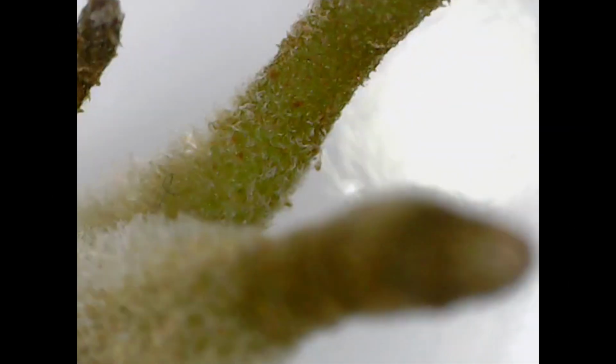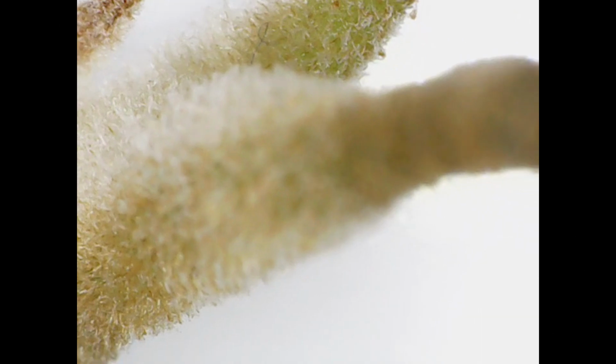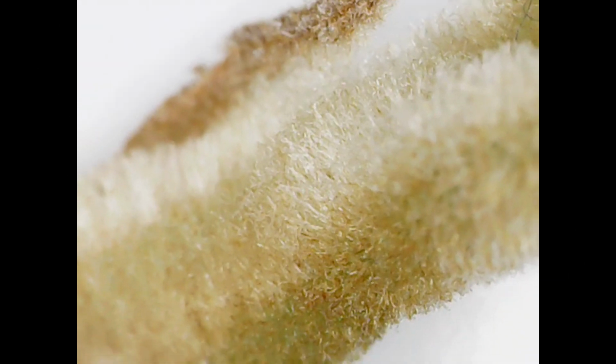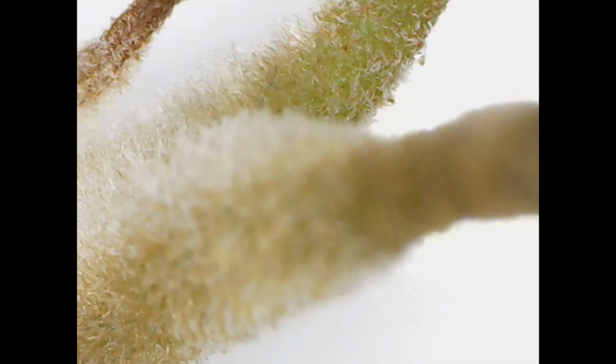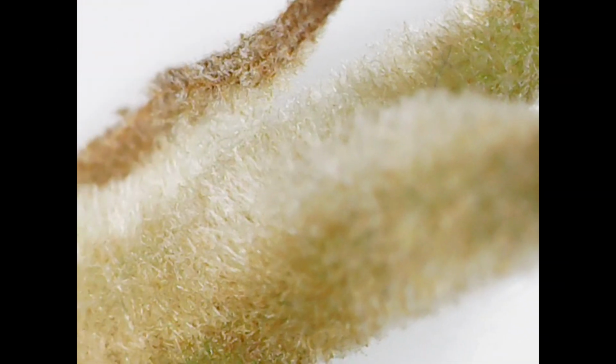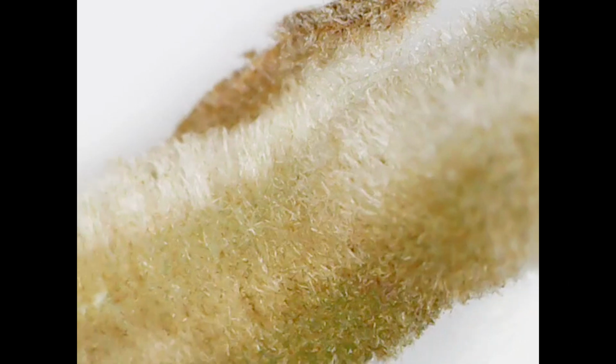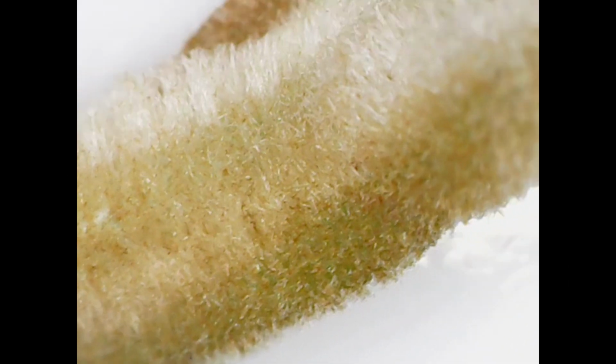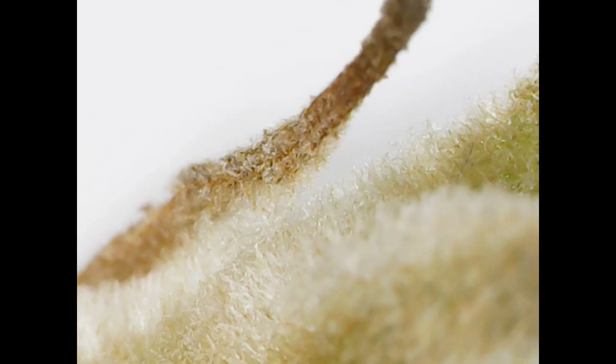And again, here we can see some of the tips, but there's a very specific reason why I put this. This is what the roots would look like on a plant that's going to attach to a plank. Look at all those little fibers that are coming off the roots. That would be what would attach to the plank. And this is very different to what you might see growing in the moss in a moss pole.